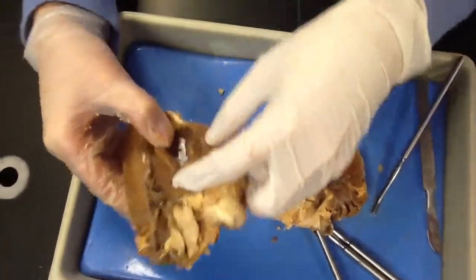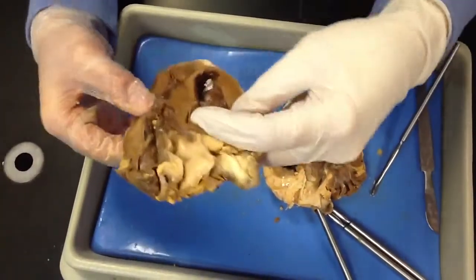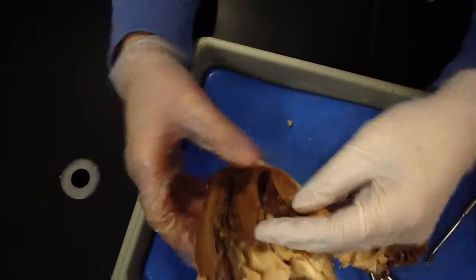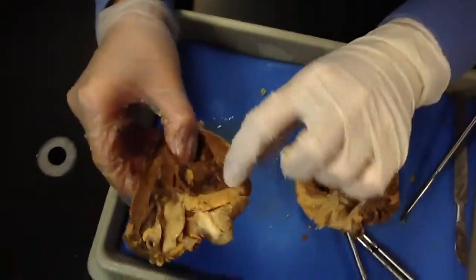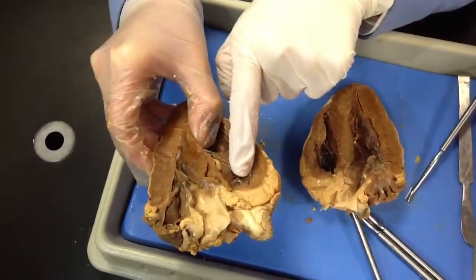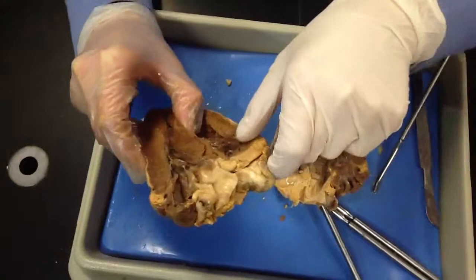Okay, and the chordae tendineae are going to be attached to papillary muscles. This one isn't as big on this side, but you'll be able to see it bigger on this side, right here. Do you see that? It's like a big indentation. And you see these ridges here in the atrium? Those are called your pectinate muscles. It should have it listed.